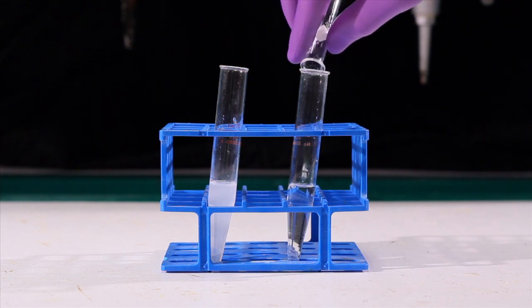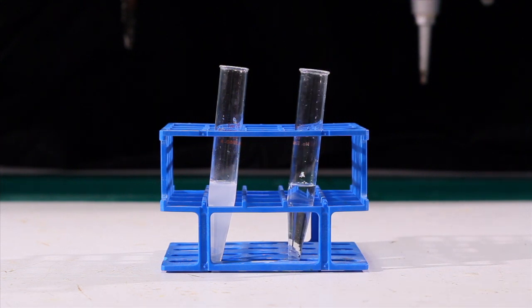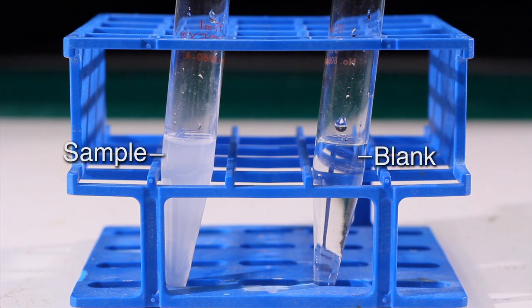To avoid catastrophic failure, each sample must have a counterbalance when placed in the rotor. If you do not have enough sample, create a blank with equivalent mass.